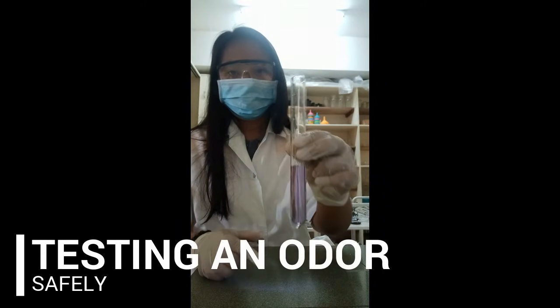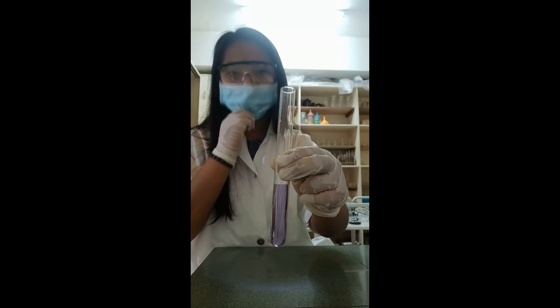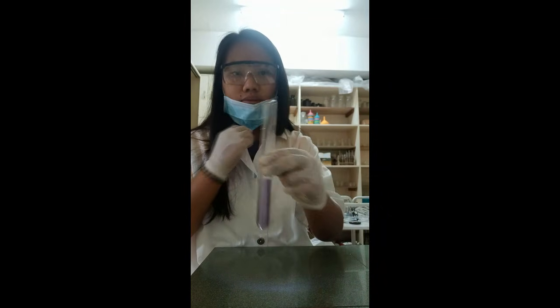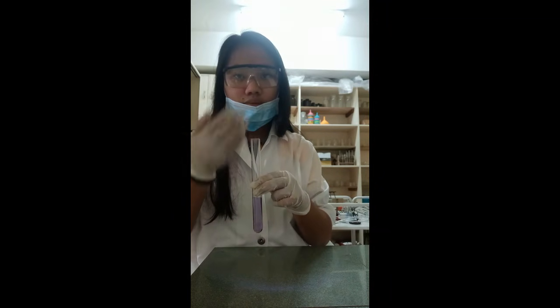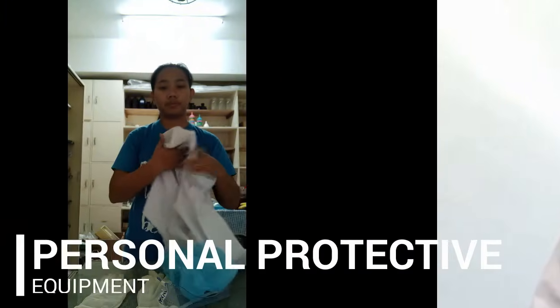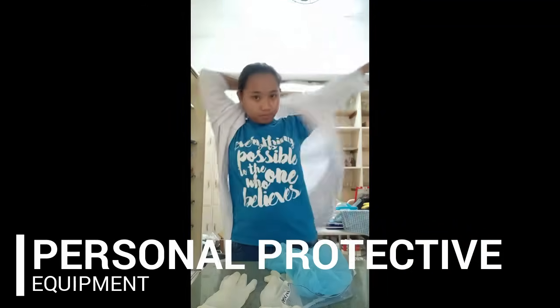Testing an odor safely. For testing the odor of gases, just waft your hand over the test tube and cautiously sniff the fumes. Do not inhale any fumes directly. Use a fume hood whenever poisonous or irritating fumes are present. Personal protective equipment is always necessary to protect workers from chemical exposure and other hazards.